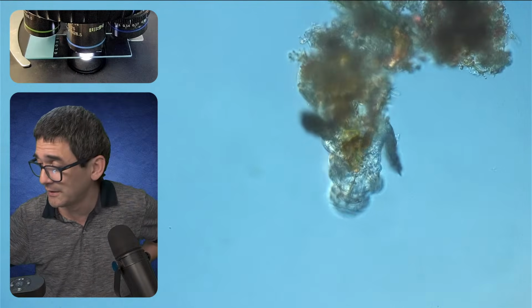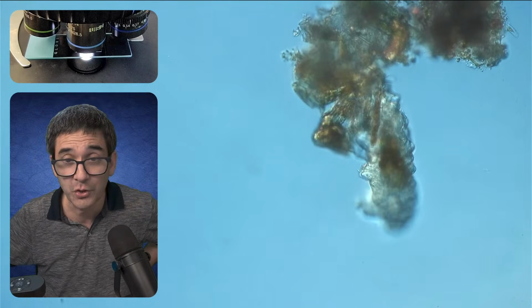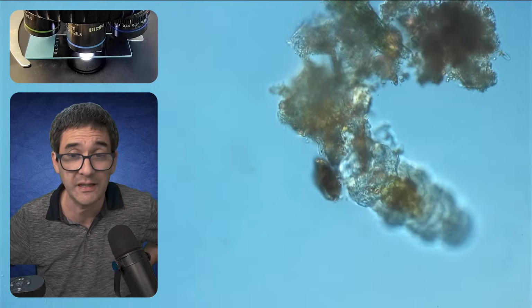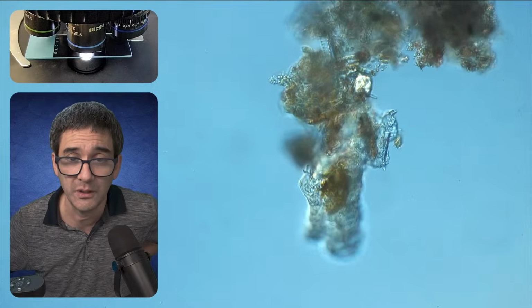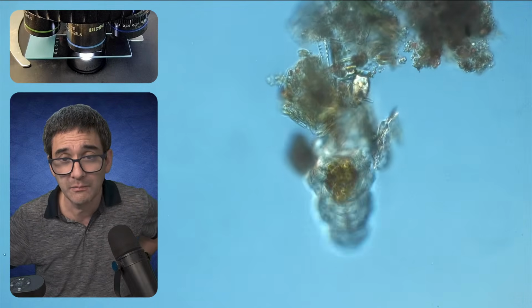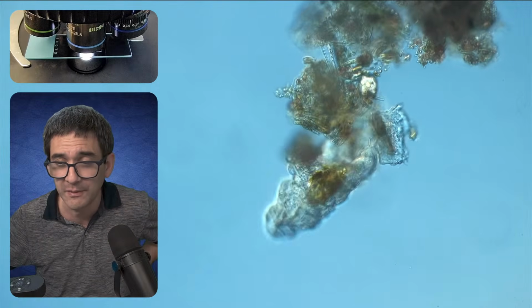Or what happens if I just leave the slide here under my microscope and it dries up and the microorganisms and animals die? Is this moral? That's a very common question that students ask me, and I also got it in the forum and in the chat.